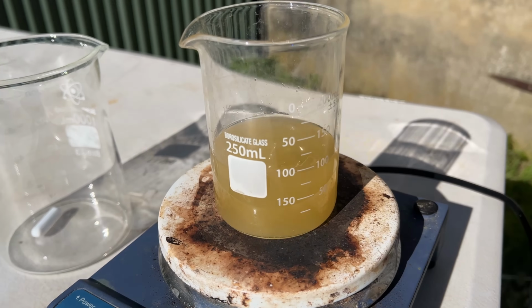So let's do this all again, but dissolve a whole heap of salt in there first.